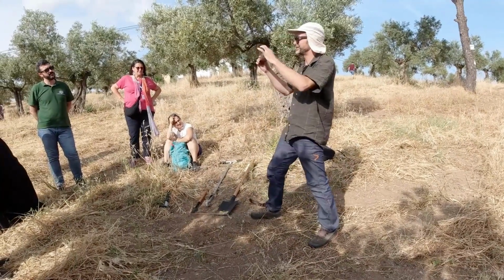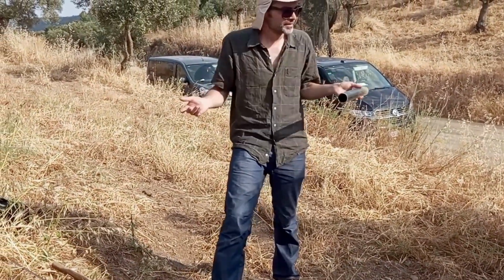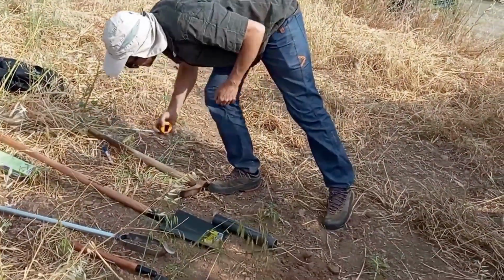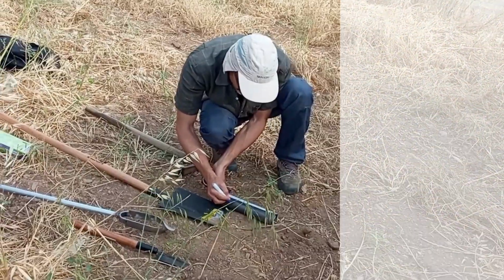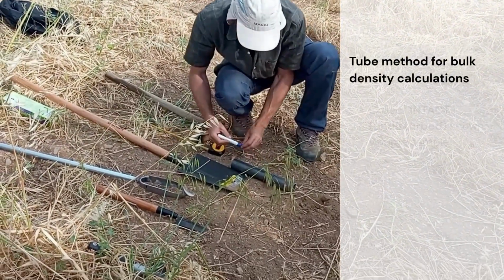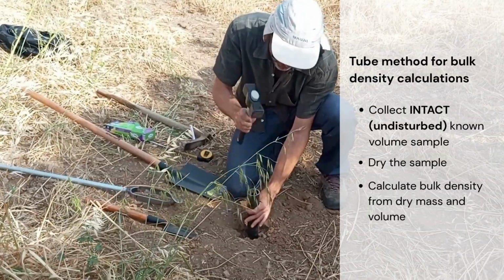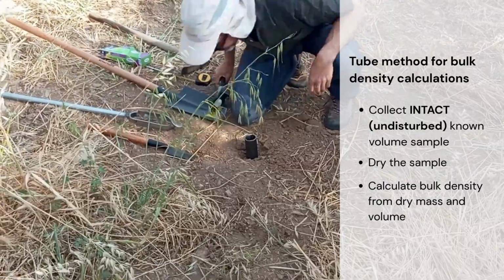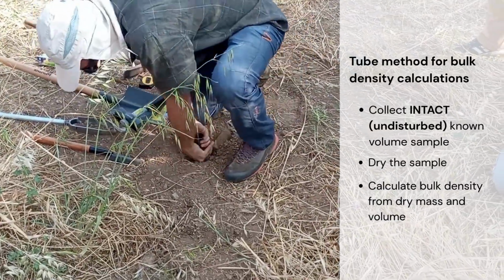If using a pipe or corer, you can cut intact cores at specific intervals, for example 0 to 10, 10 to 20, 20 to 30, 30 to 40 centimeters. This simple tube method is also useful for bulk density. Collect an intact core of known volume, dry it according to lab instructions, and calculate bulk density from dry mass and volume. Note that bulk density cannot be measured from disturbed auger samples.